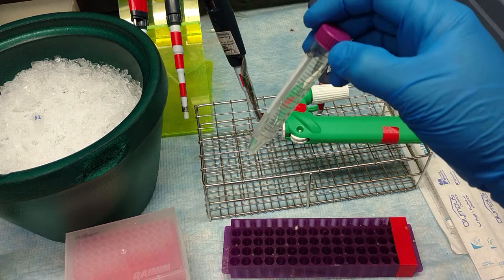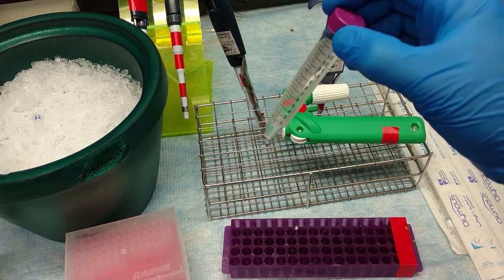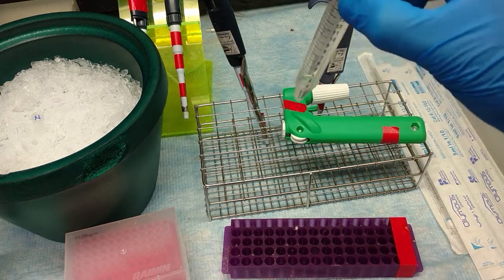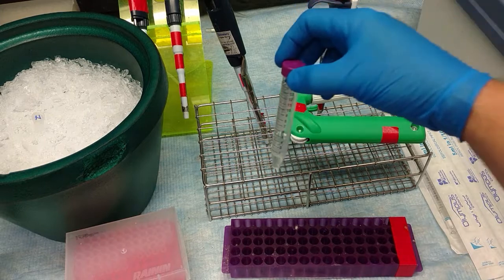Now, this has to be fresh, fresh, fresh, isolated that day, harvested that day. So we have brand new lysate, and we're going to put a nuclease in it.